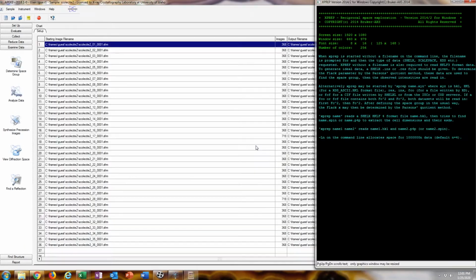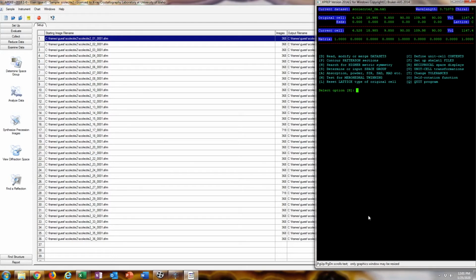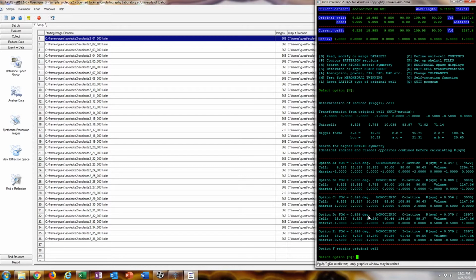Now we're going to determine the space group, and here, because of all that business with the unit cell, we have to be kind of careful. Normally you can just click through this, just enter until it closes. But here, as you can see, option B, it wants as the crystallographic setting, and that would probably be normally what you would want. But I'm trying to use the convention that was used by another author, so I'm just going to retain the cell that we determined already and select F. And after I do that, you can pretty much just click through this prompt.